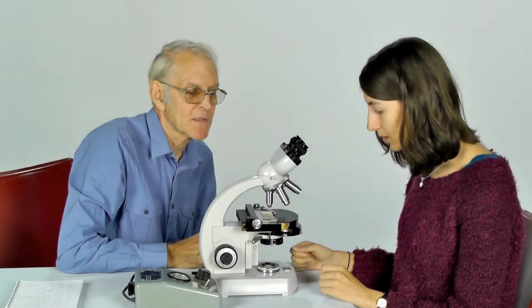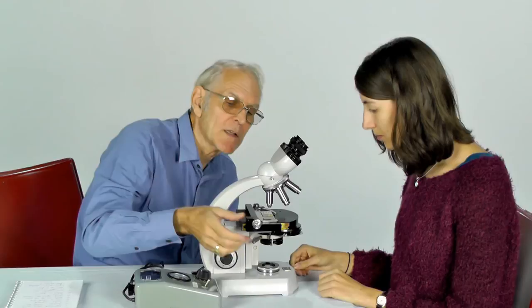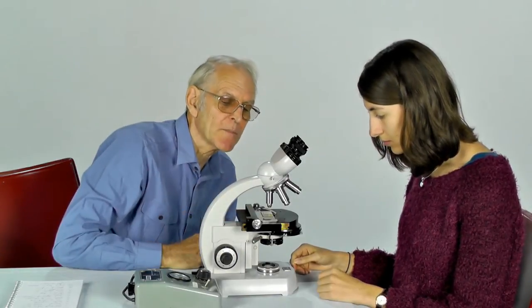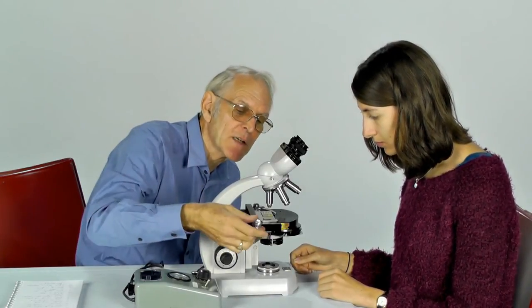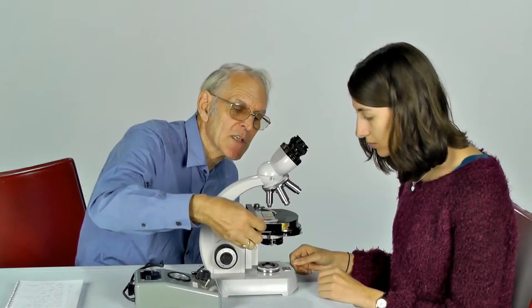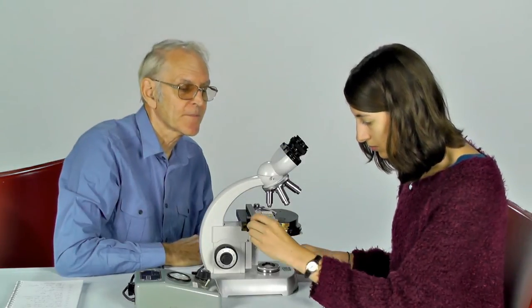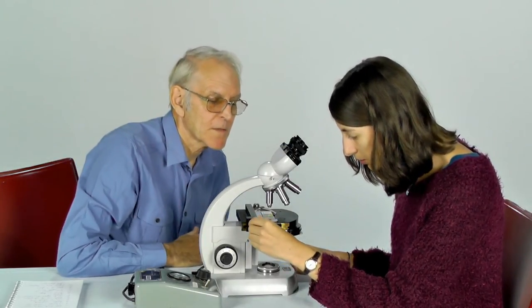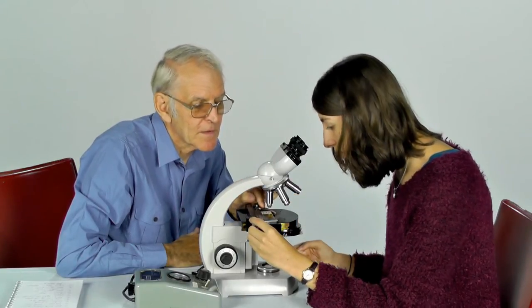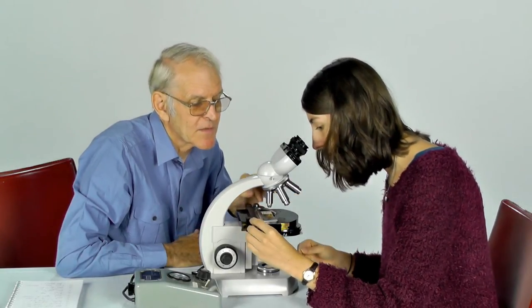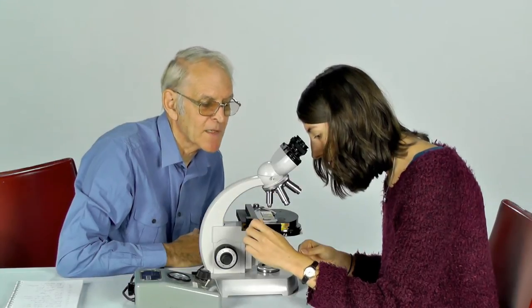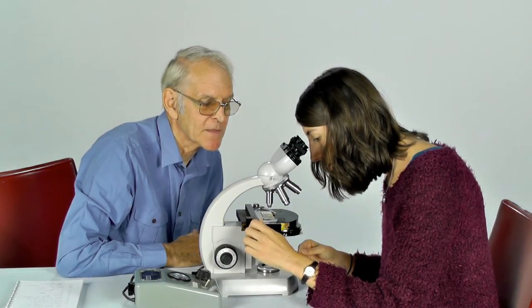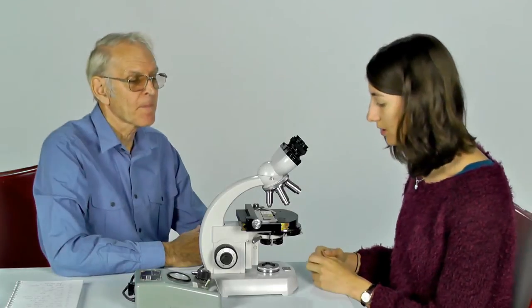Now you can adjust the position of your specimen using the mechanical stage control knobs. Am I looking for that little circle of light to be on the specimen? The specimen needs to be directly above that little spot of light. That looks fine. Good.